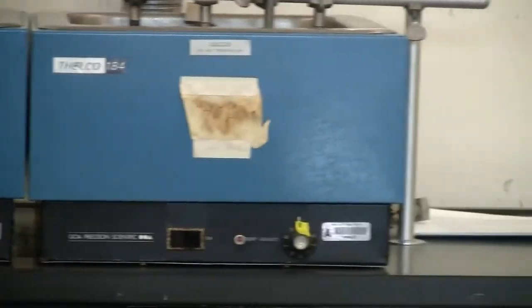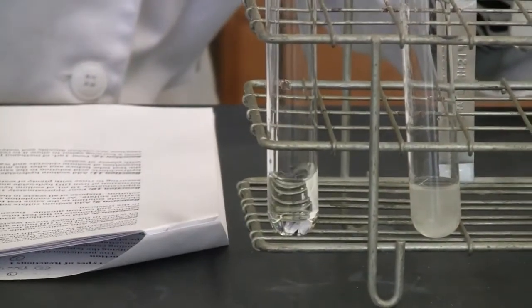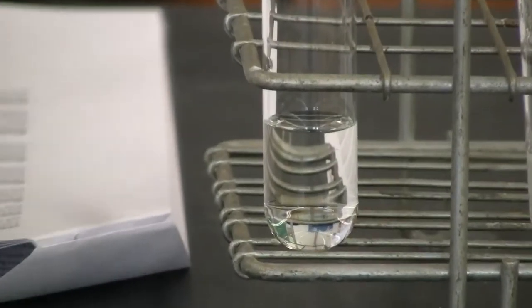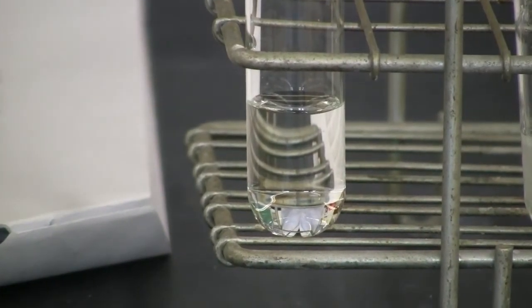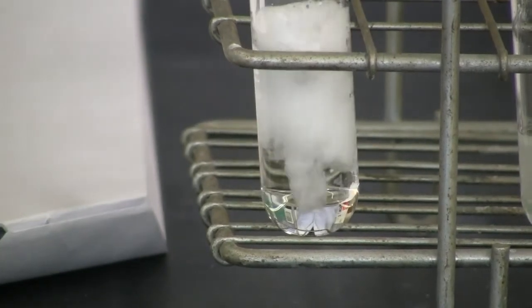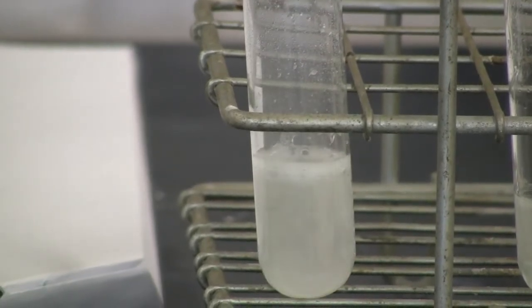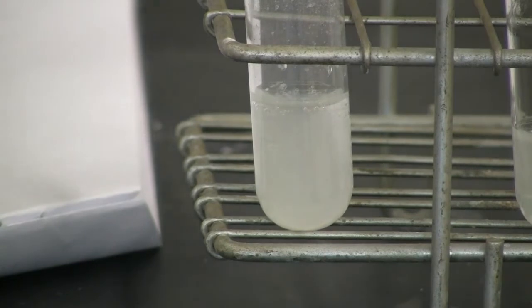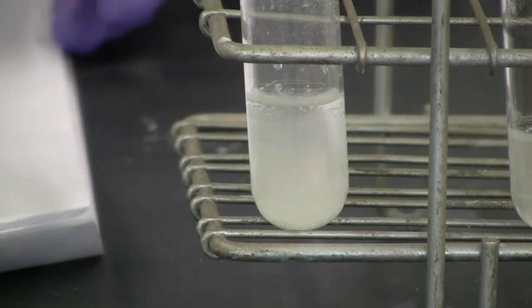It's too quick, so I'm going to put some acid there first. Maybe we can zoom it in more. And notice the quick change. I think this time you capture the quick change. Okay. All right.